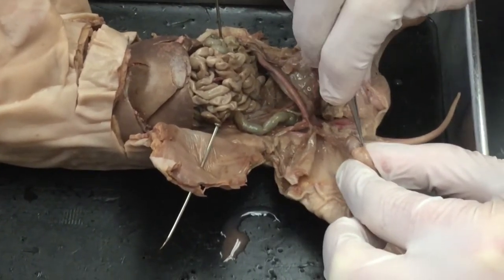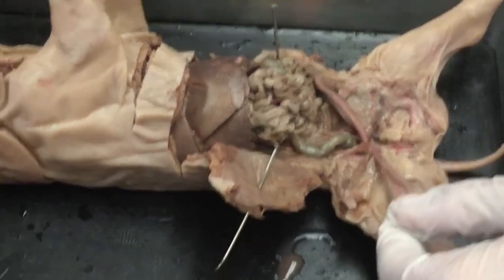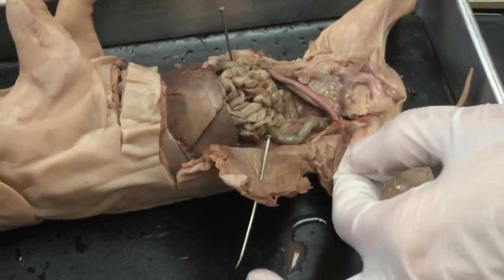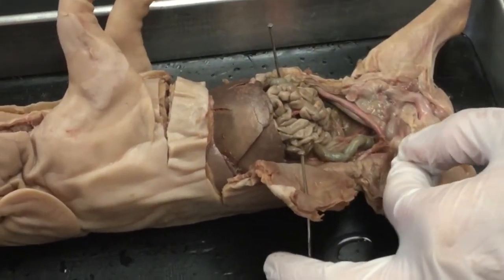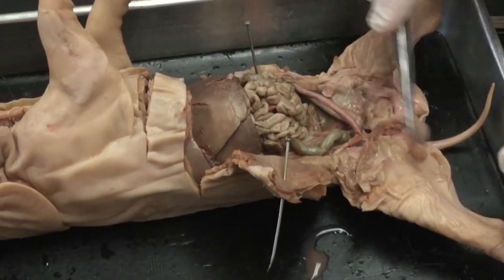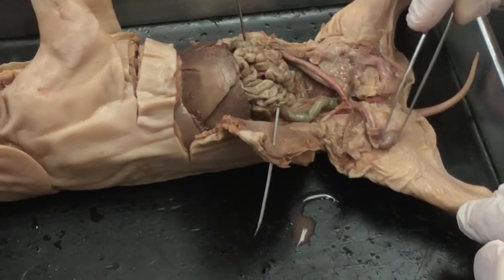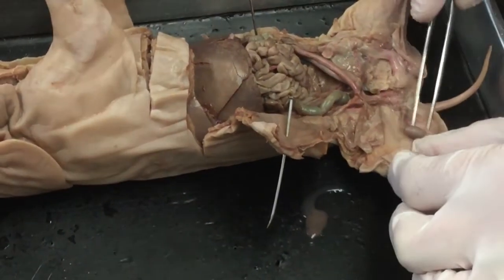It's very thin, and if I remove that, and I'm going to use my scissors to do so to expose the epididymis. So I'm getting my scissors way down in there, and when I do that, now I can see the testis is completely exposed. And as that testis is exposed, I see that on the top of it, hold on, let me turn this around. Let's see where it is.